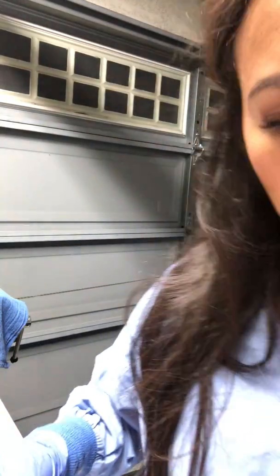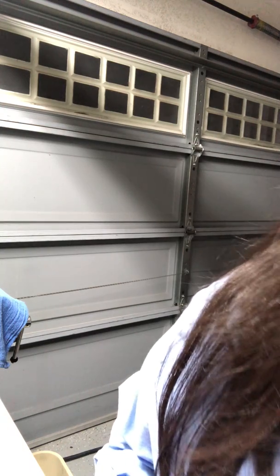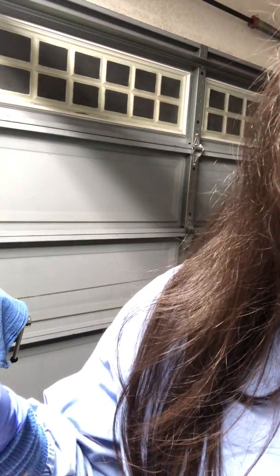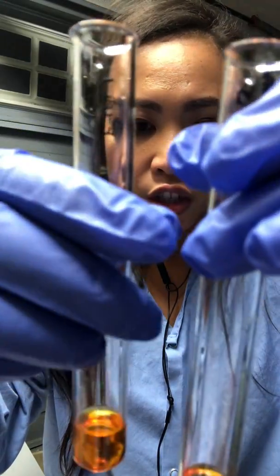I just stored mine upright into this cup with a cover to avoid spillage. With the Methyl Red experiment, it showed the acid fermentation. That's the whole point to that project, to see whether the bacteria is positive or negative. So, with that said, the Methyl Red is used to test the pH of the bacteria. In this case, after adding the Methyl Red, clearly it shows reddish.